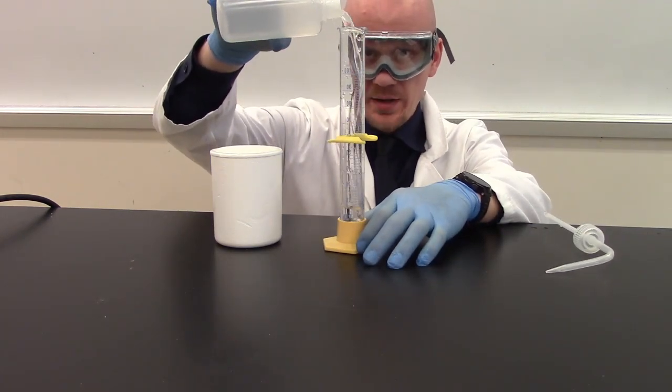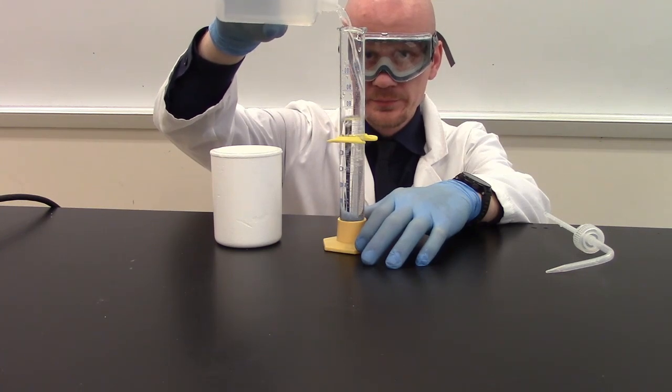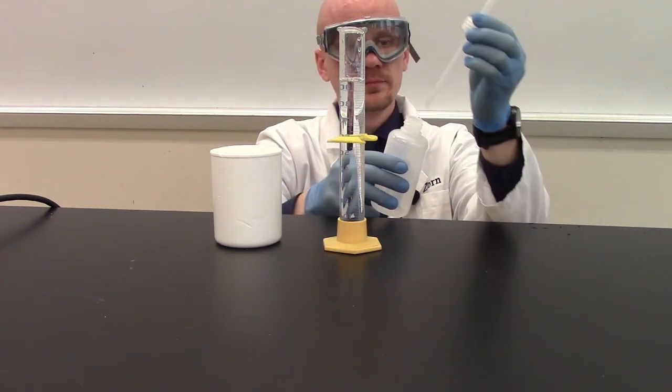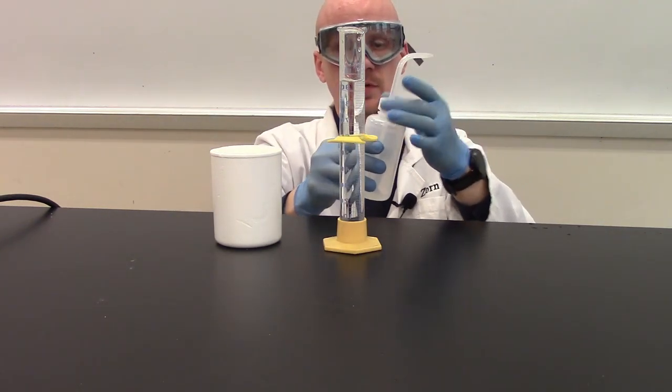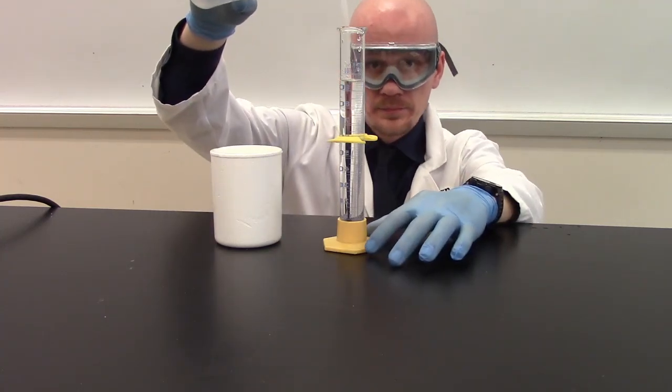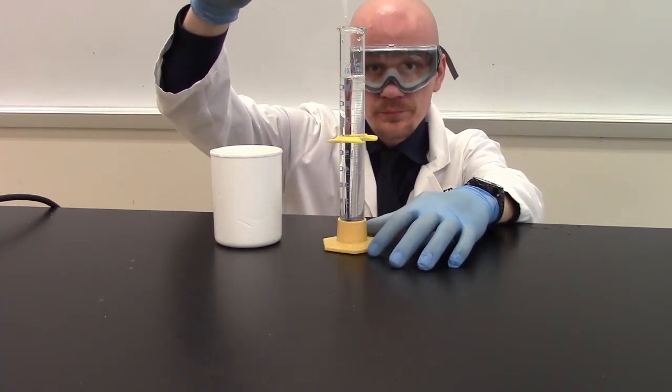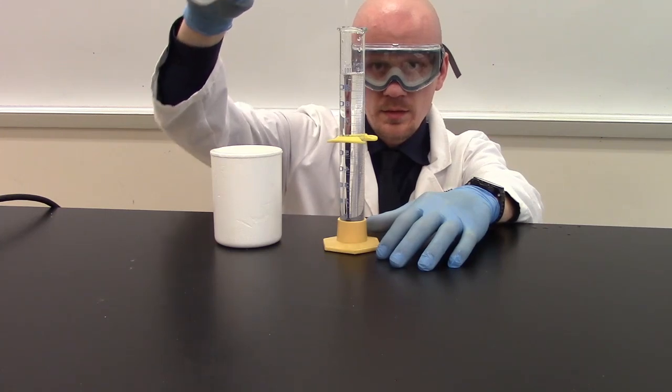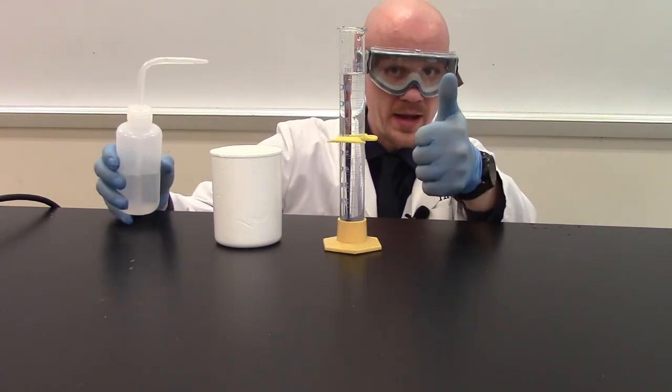So I'm going to take my distilled water bottle and I'm going to fill up the graduated cylinder with 100 milliliters of distilled water.